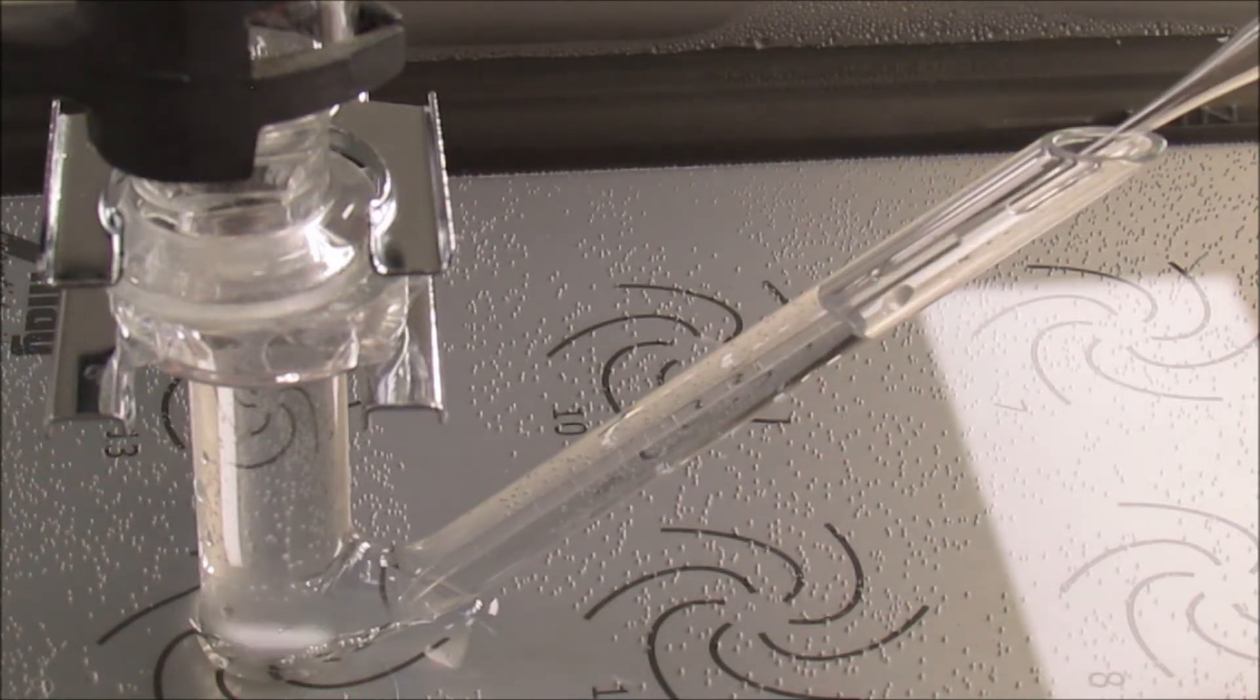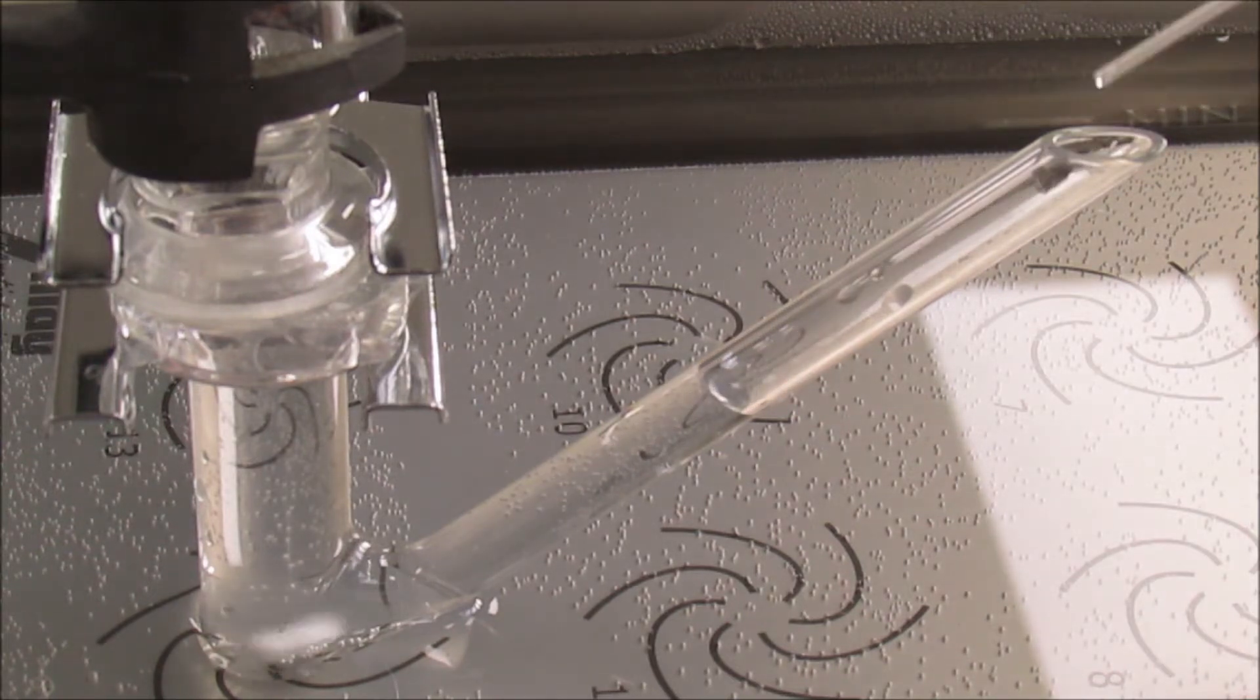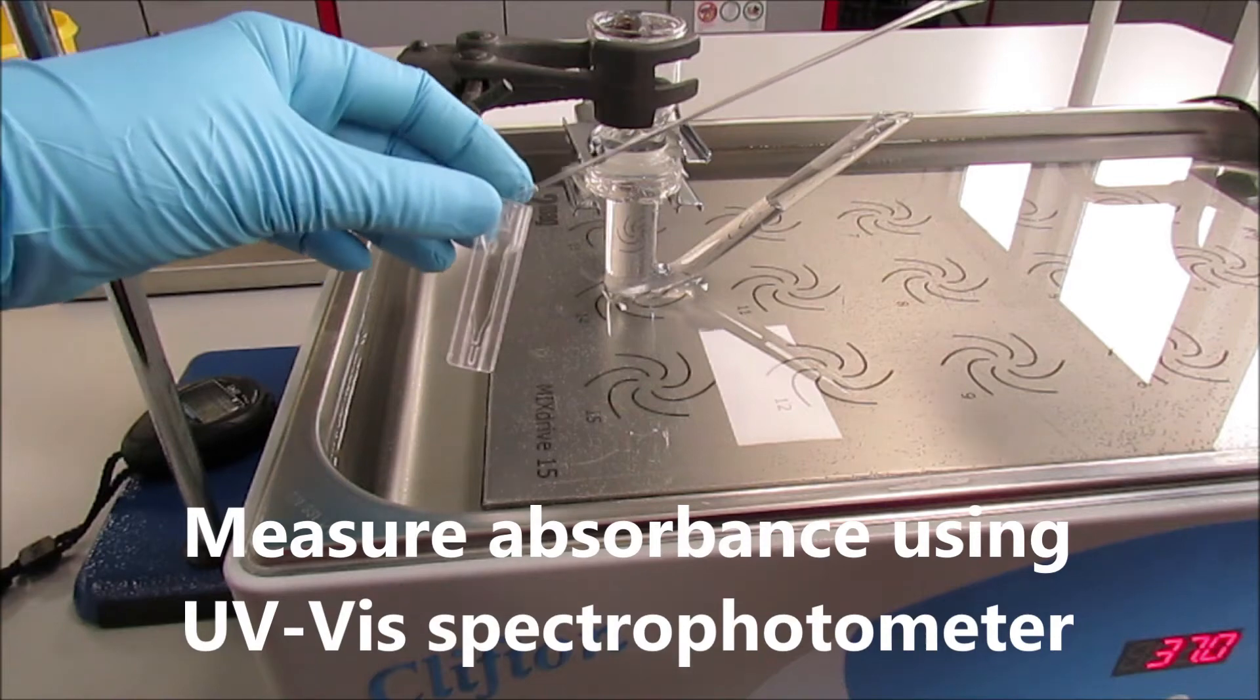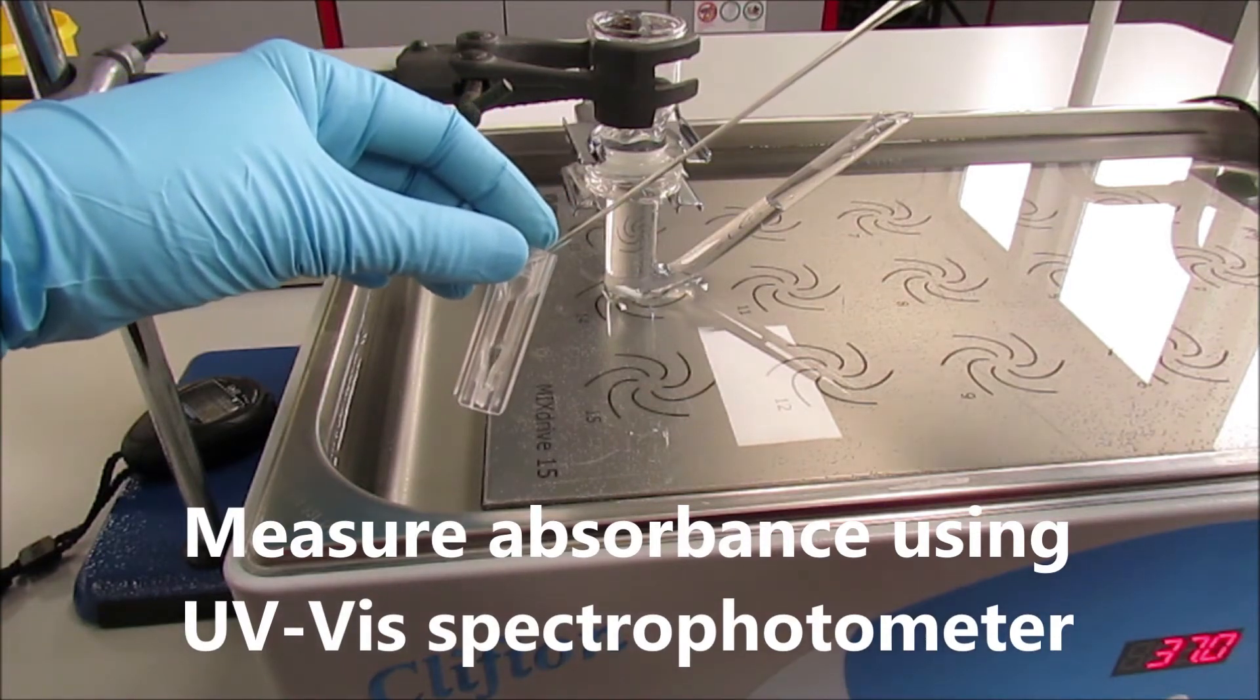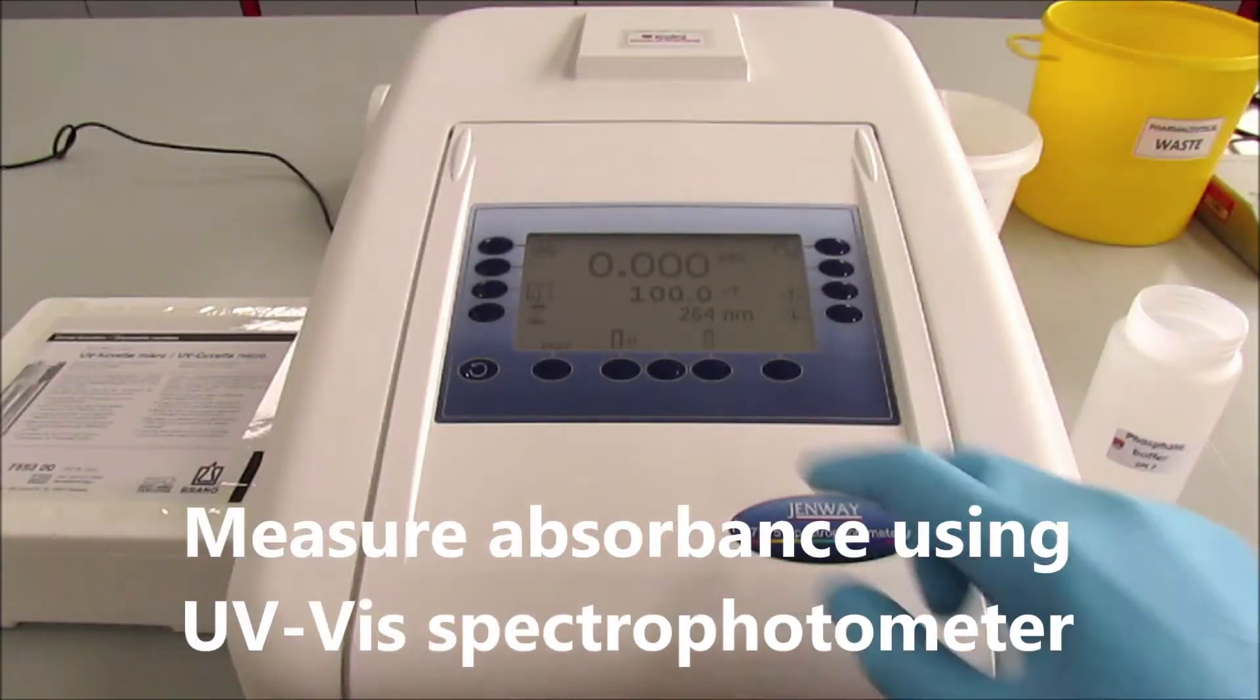We carefully take out a sample, put it into the cuvette, and measure the drug content spectrophotometrically.